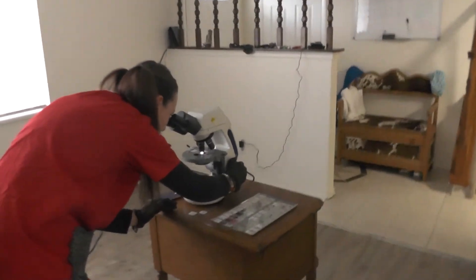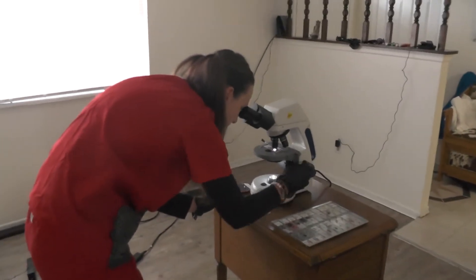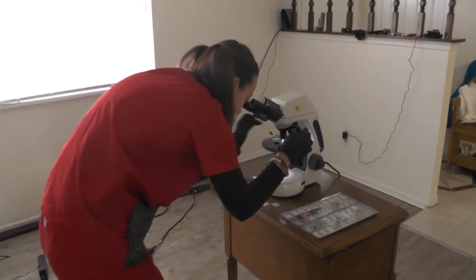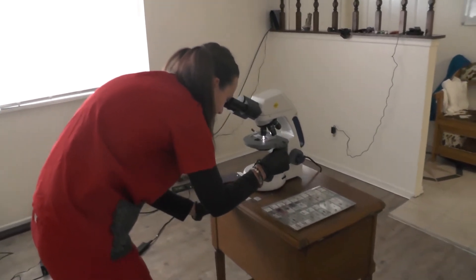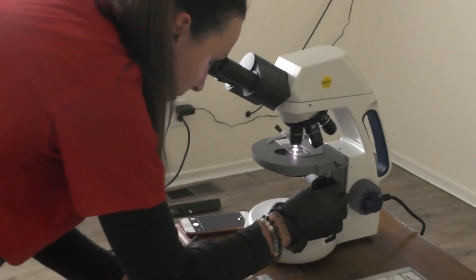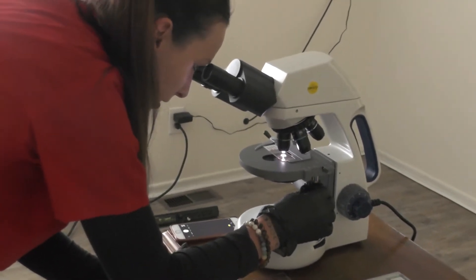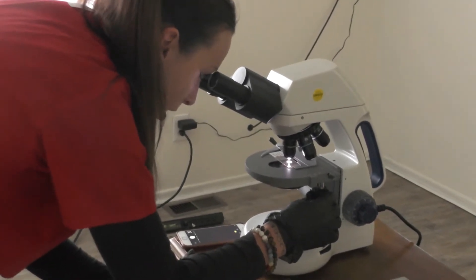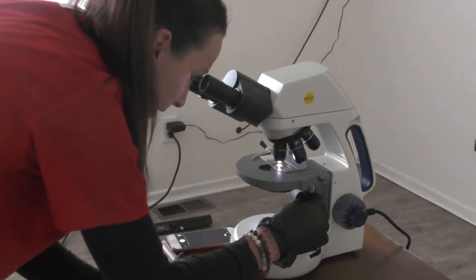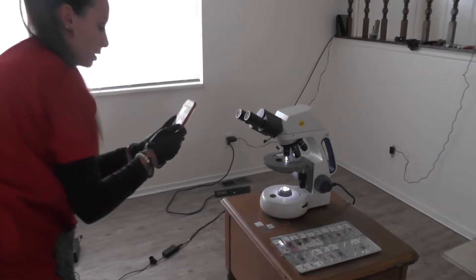Okay, so here I have my seminiferous tubule and I'm going to put it in the lumen of the seminiferous tubules so you can see these little spermatocytes. Alright, so I've got a really good picture.